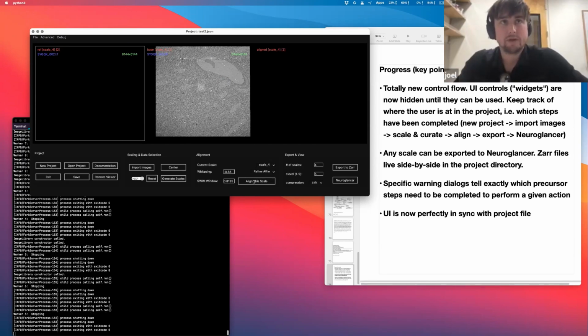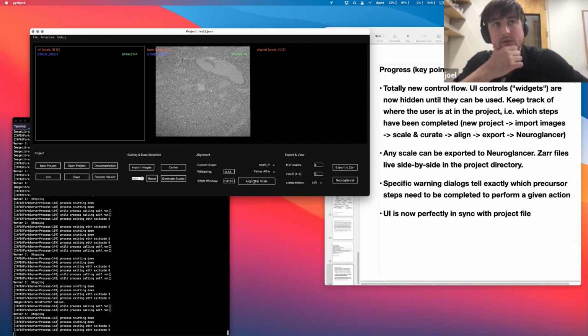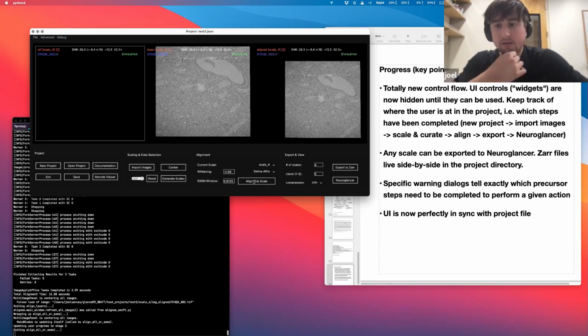So just a few things. What I'm showing on screen right here, these are very large images. These are like as large as it gets ones. They're like half a gigabyte per image. And I'm aligning a few of those just so that it handles large images.